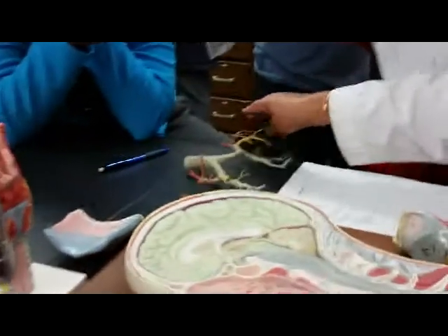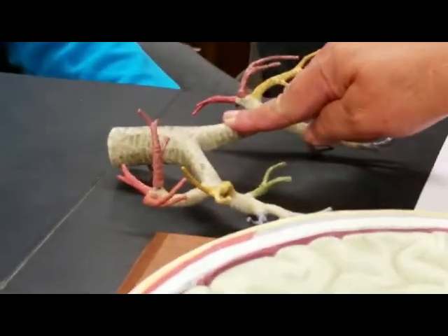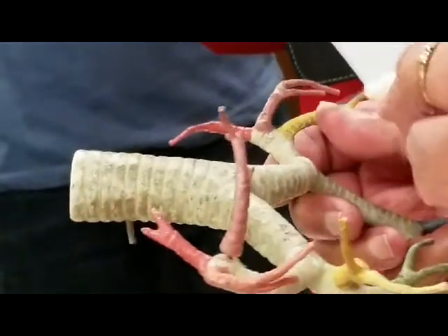And it's going to be specific. So it's on the table, you can't pick it up. This is my right hand, therefore this would be the left primary bronchus. This is the right primary bronchus. We're not going to worry about the bronchioles. This is the trachea. If I stay on one, it's the cartilaginous ring. This would be the left primary bronchus, right primary bronchus. If I use this, again, trachea, and you have the left primary bronchus and the right primary bronchus.